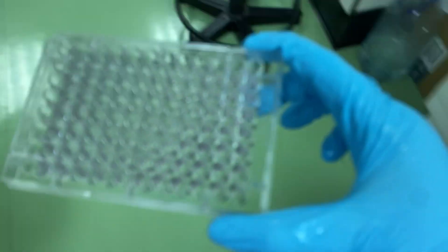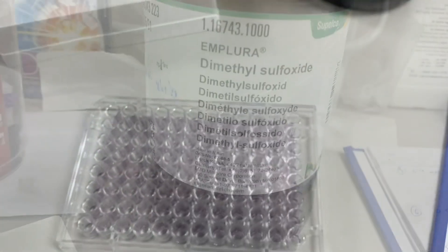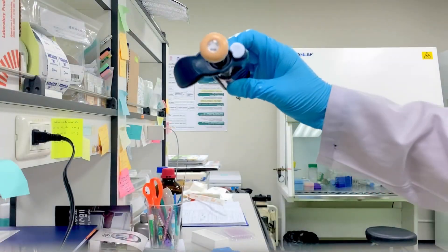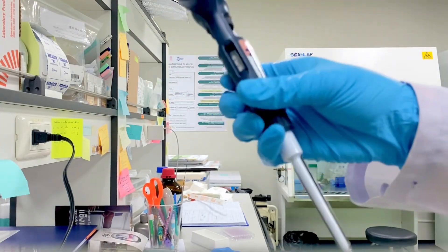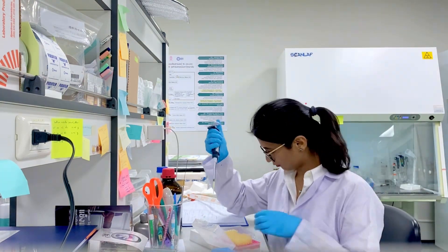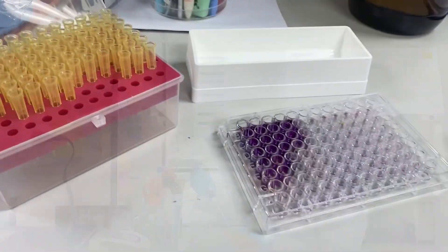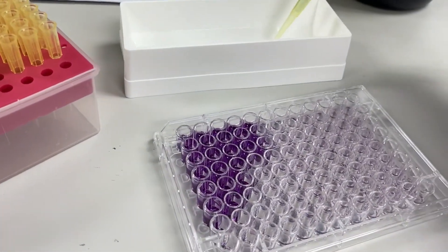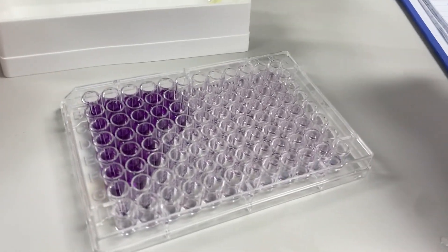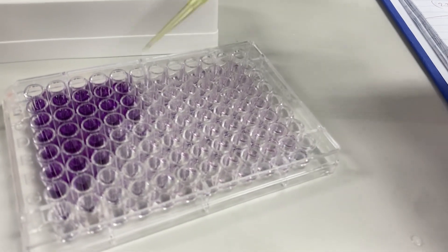Now I'm taking my plate to my station. I already have DMSO taken out in the reservoir because I need 100 microliters, so I'm using a 100 microliter pipette. It's very important to use the appropriate pipette for accurate volume measurement. Because of the presence of formazan crystals, when I add DMSO the color turns purple as the crystals dissolve into the DMSO.